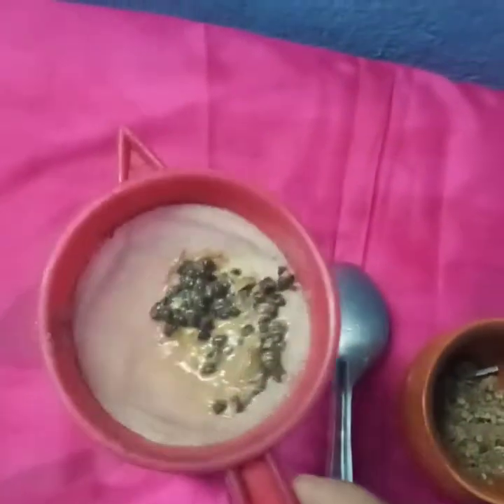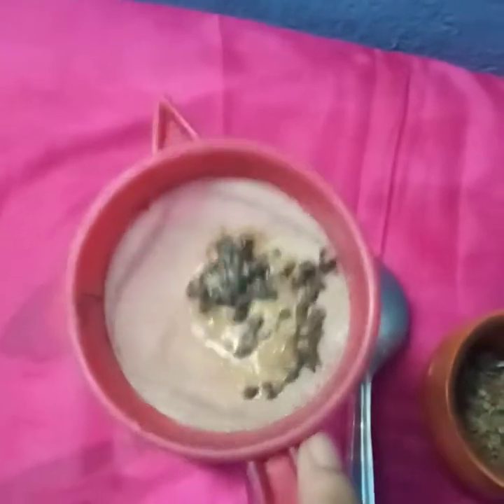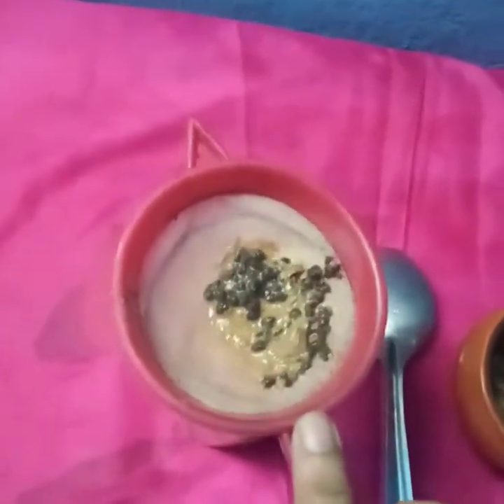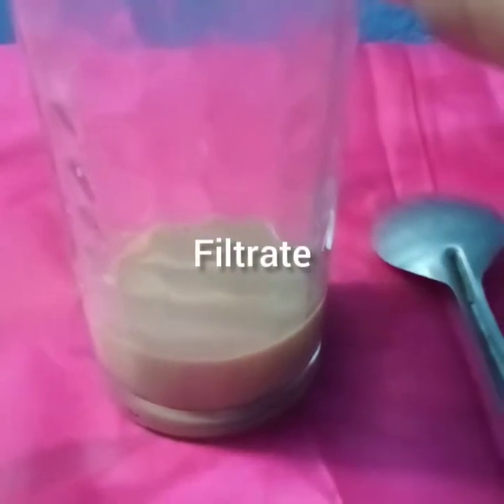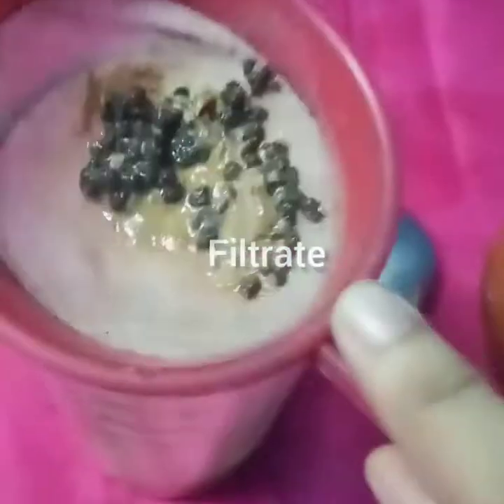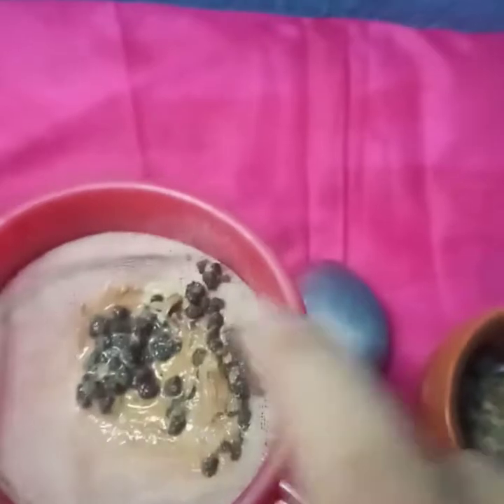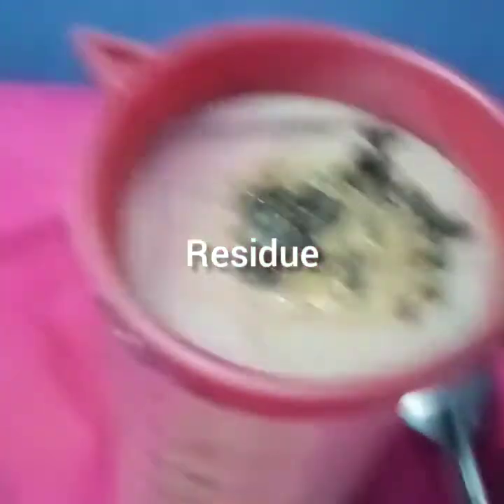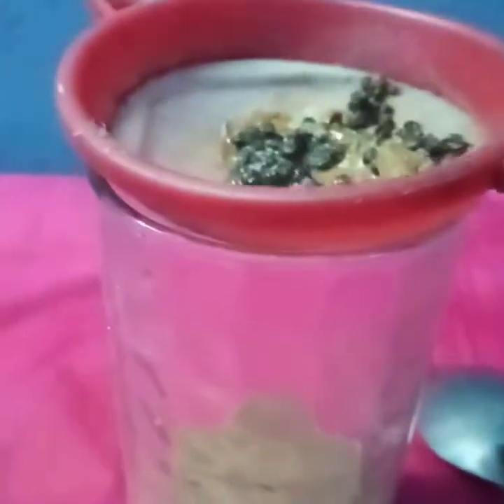So children, the liquid after filtration is called filtrate, which is this liquid you are seeing down. This liquid is called filtrate, and the solid left behind, this solid you can see here, is called residue. This tea is the filtrate, and this above you can see is called residue.